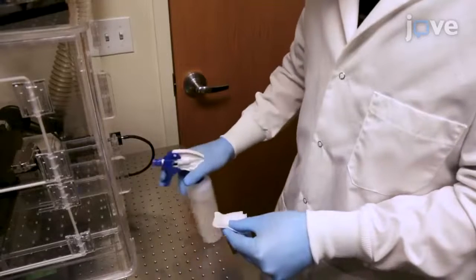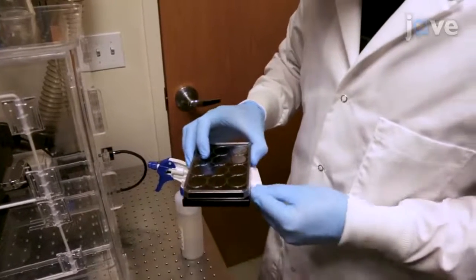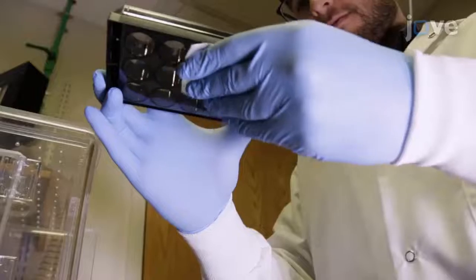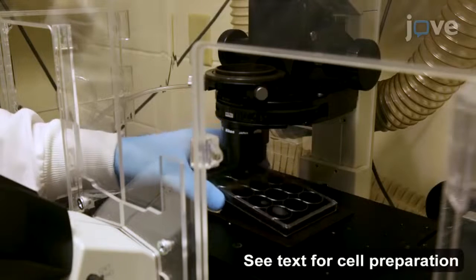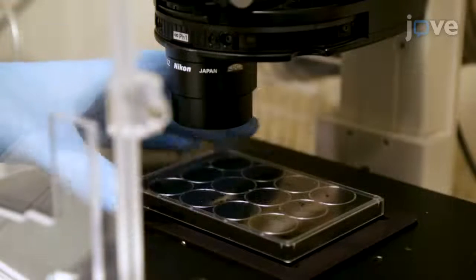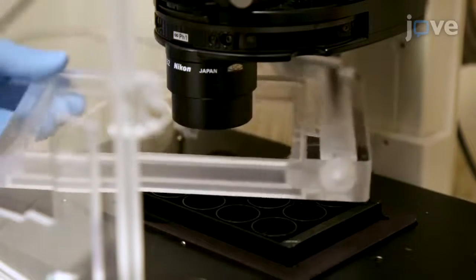To begin, clean the glass bottom of the imaging dish with optical cleaner to remove any fingerprints or dust that may interfere with imaging. Use sufficient optical cleaner to wet the entire glass surface. Place the glass bottom dish with cells on the microscope stage in the imaging dish adapter. Remove the plastic cover from the dish and cover the dish with a glass-topped chamber.